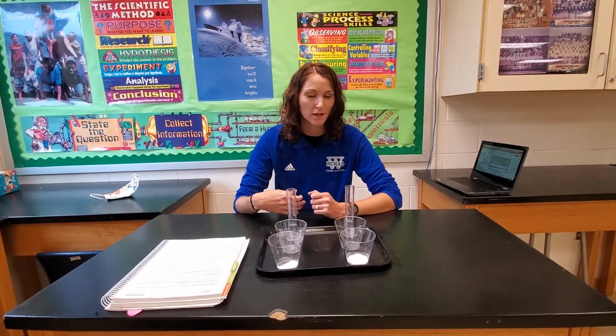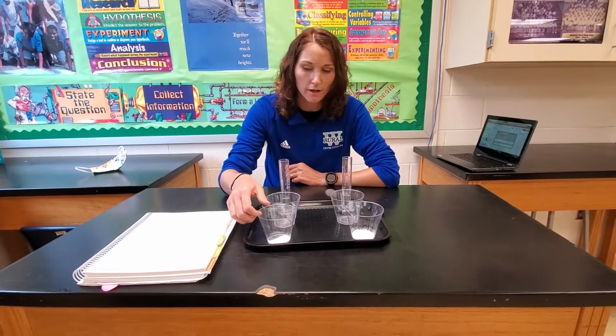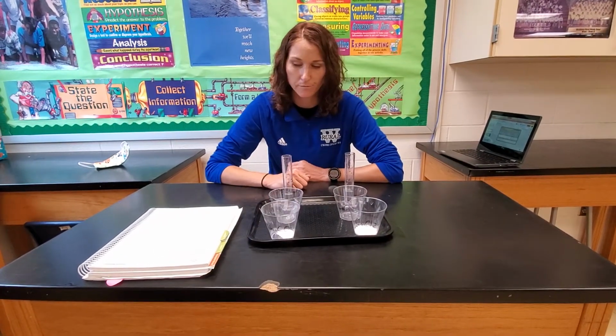Hi, I'm Mrs. Latterback, and I'm going to run you through the hands-on portion of the lab today. So our investigation question today is whether or not different substances can change into another substance. So right here, I've got some calcium chloride, and I have sodium carbonate.